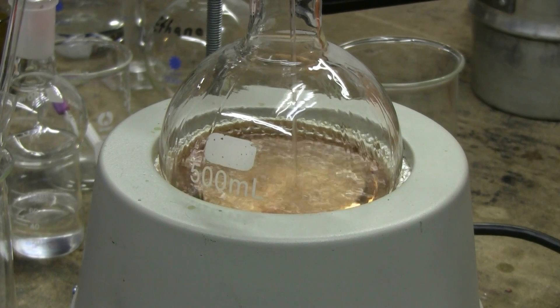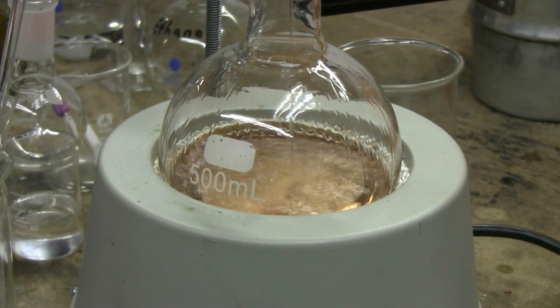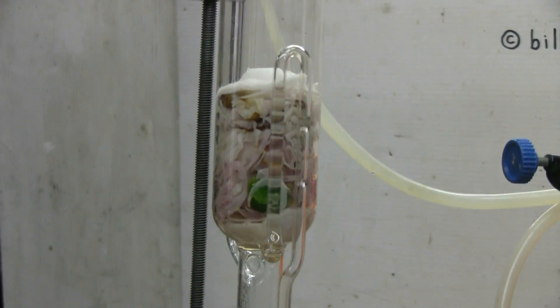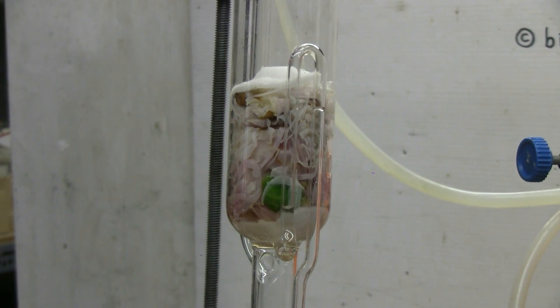And it appears to have pulled a little color of the flowers down. Using ethanol, ether didn't touch the color. Cycle number one is finished siphoning, and the flowers look a little faded. Color is being pulled out of them with the ethanol that was not pulled out with diethyl ether.